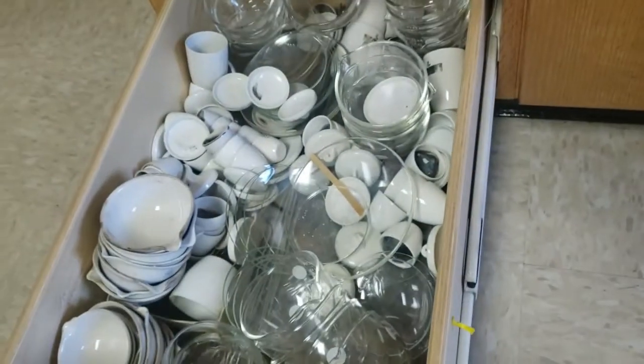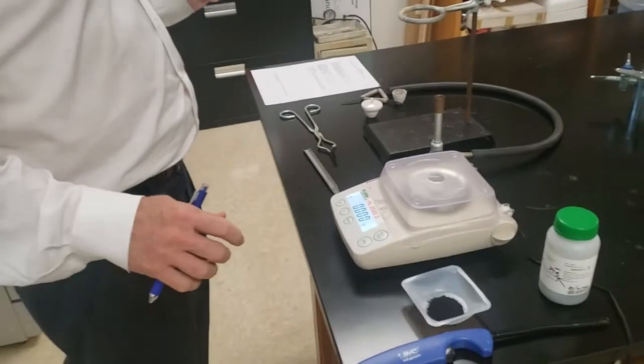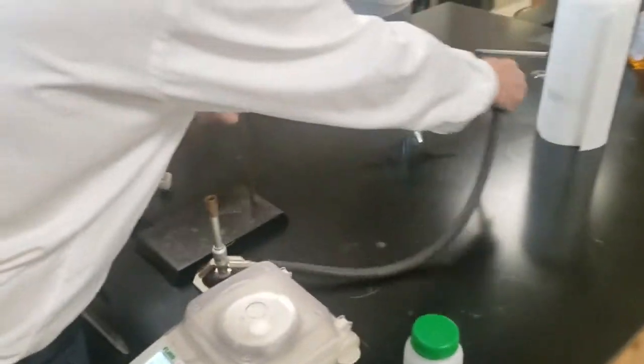Crucibles with lids. The lid needs to cover the crucible completely and not just sit on there.